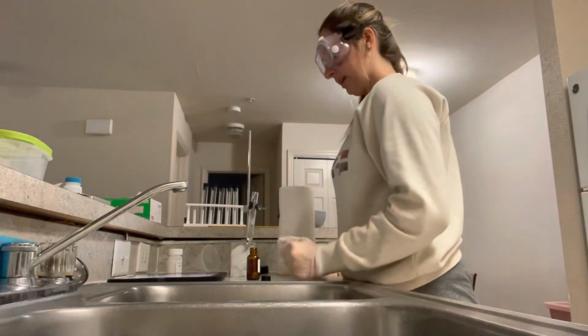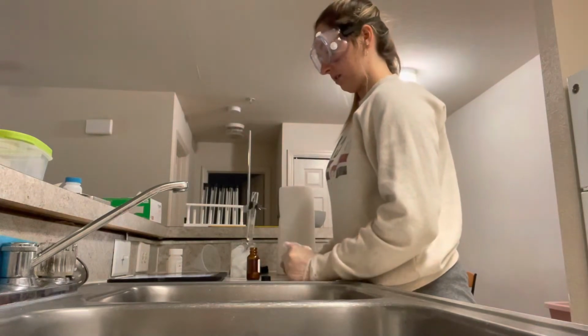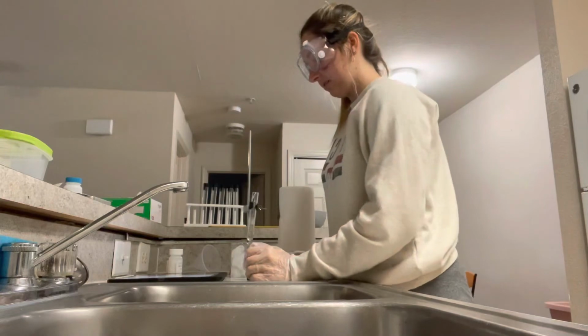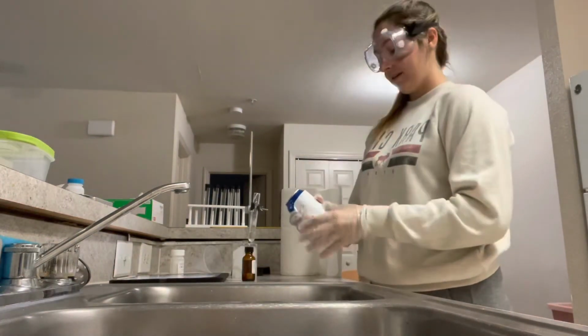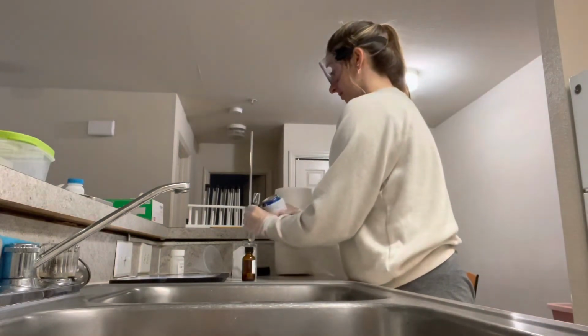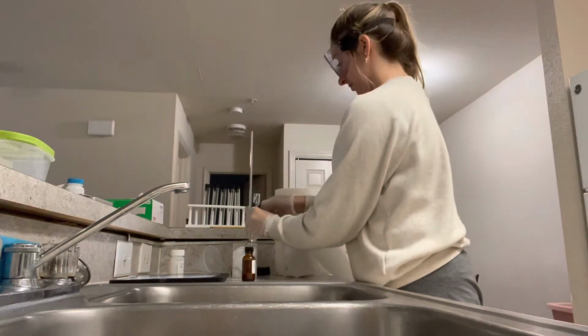Now pour the molten mixture into a specific waste container, a can or milk carton. Those are the pots. Do not pour in the sink. So now I will pour this into a can. It is covered up for other reasons, or school appropriate reasons.